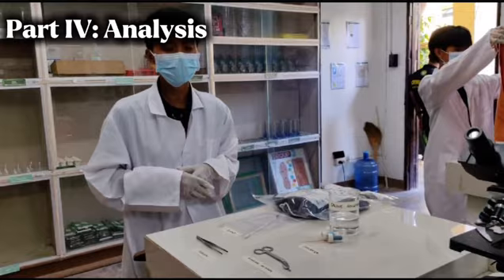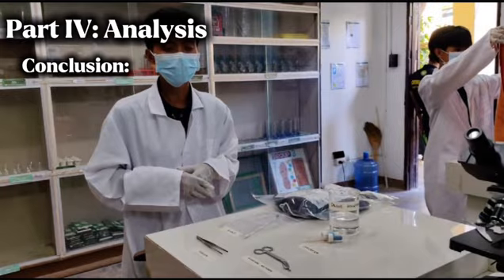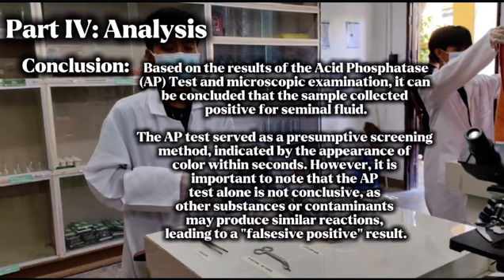substances. Now, the conclusion. Based on the result of the acid phosphatase test and microscopic examination, we concluded that the sample collected is positive for seminal fluid. The AP test served as the presumptive screening method, indicated by the appearance of color, which is purple.